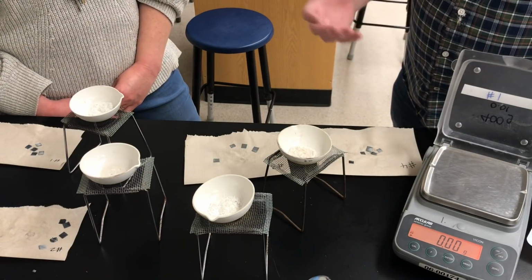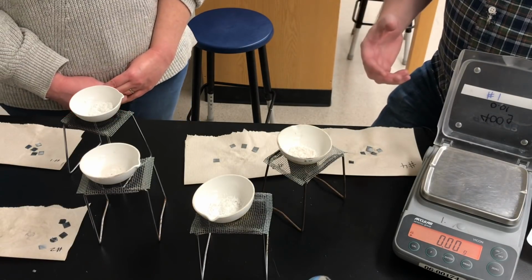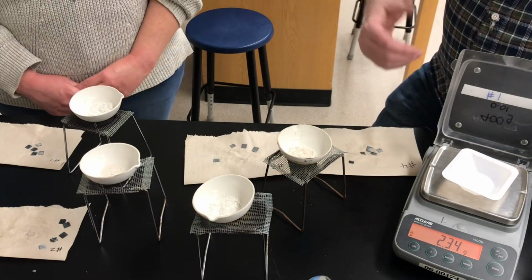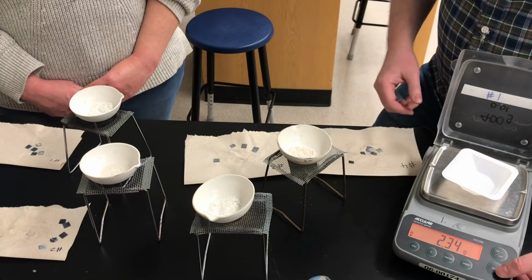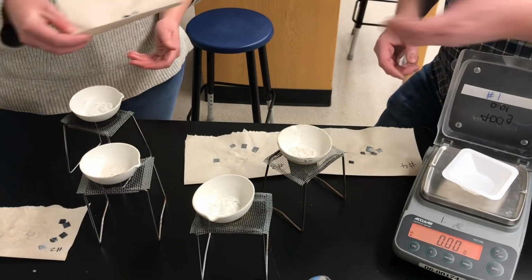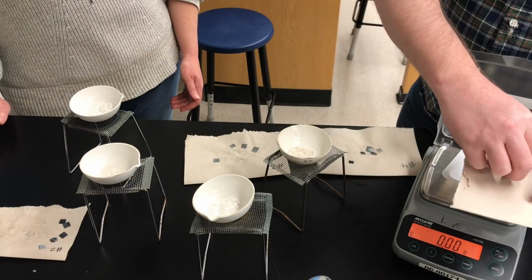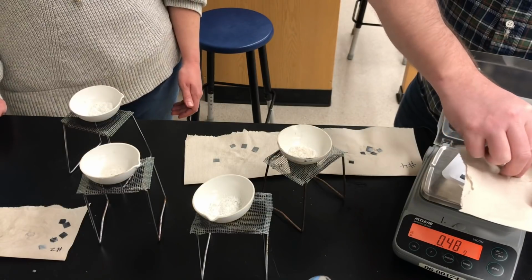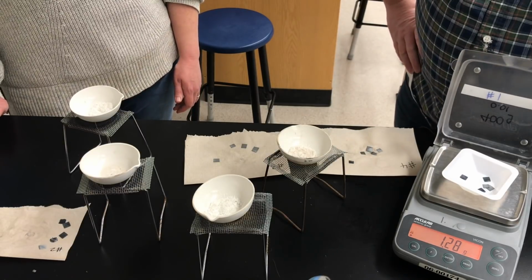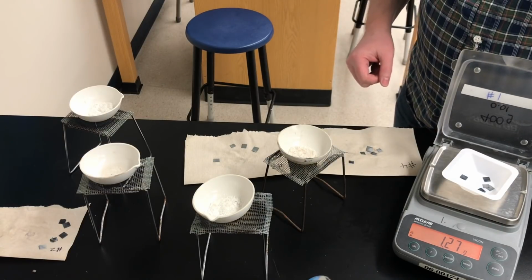Now, for grade 9 students, we need to do one last thing. We need to know how many grams of zinc metal did not react. We need to know how much was the zinc metal's mass that's left over today. So I'm going to put a weighing boat and I'll zero that on my balance. So let's begin with test tube 1. So you recorded at the beginning the mass of zinc that we added to the test tube. Here's the mass of zinc that's left over at the end of the experiment. So using those two masses, you could calculate the mass of zinc that reacted in the experiment.